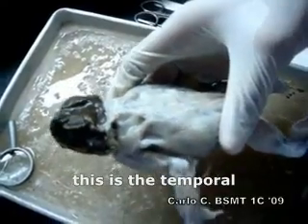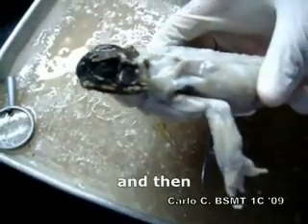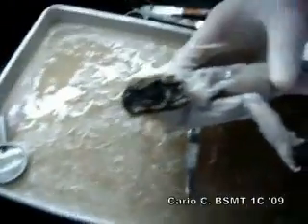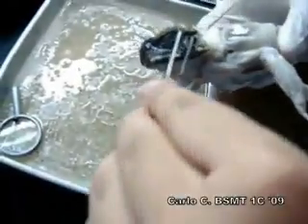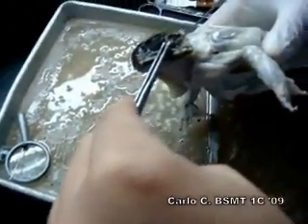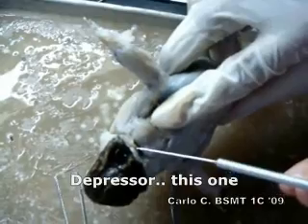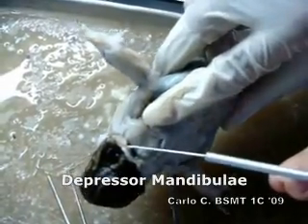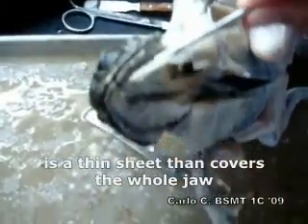Muscles of the dorsal lateral side of the head. This is the temporal — it's a circular shaped muscle. Behind that is the masseter. This is the Depressor Mandibuli. Mylohyoid is the thin sheet that covers the whole jaw.